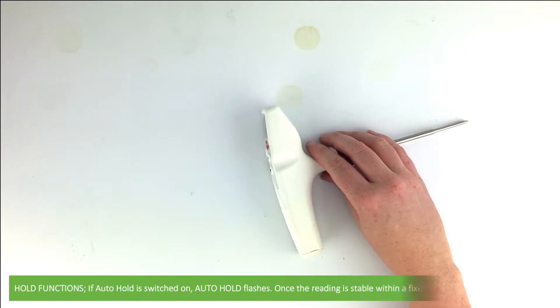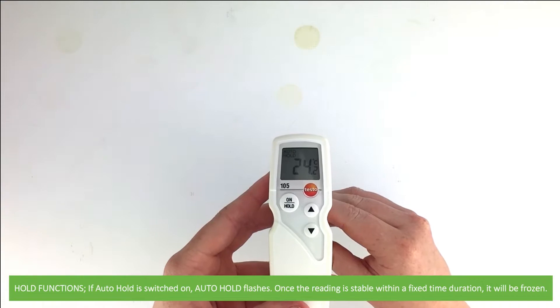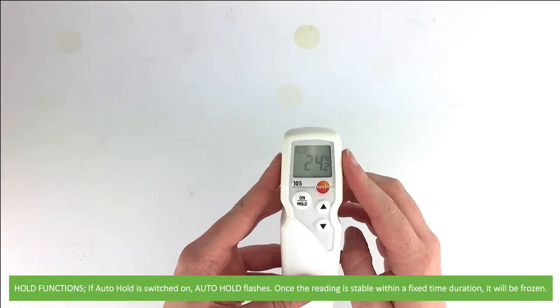Hold functions: If auto hold is switched on, auto hold flashes on the top of the LCD. Once the reading is stable within a fixed time duration, it will be frozen.